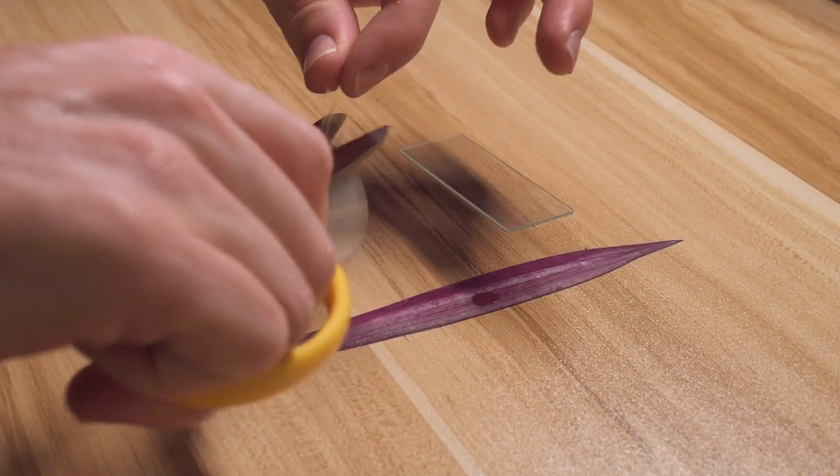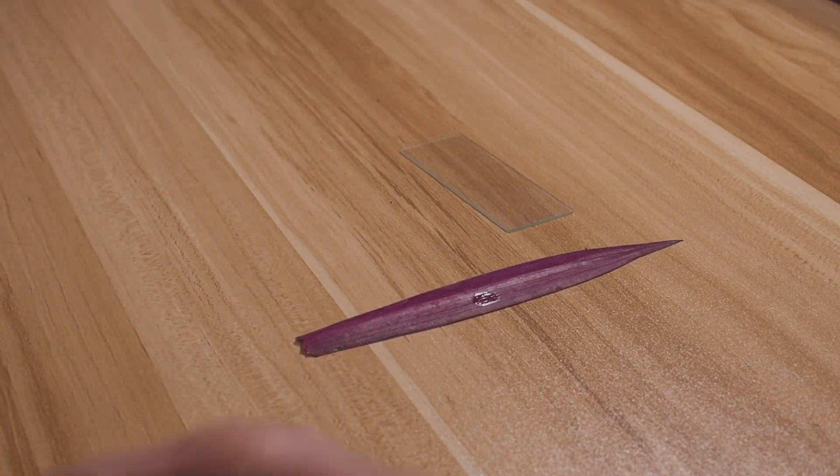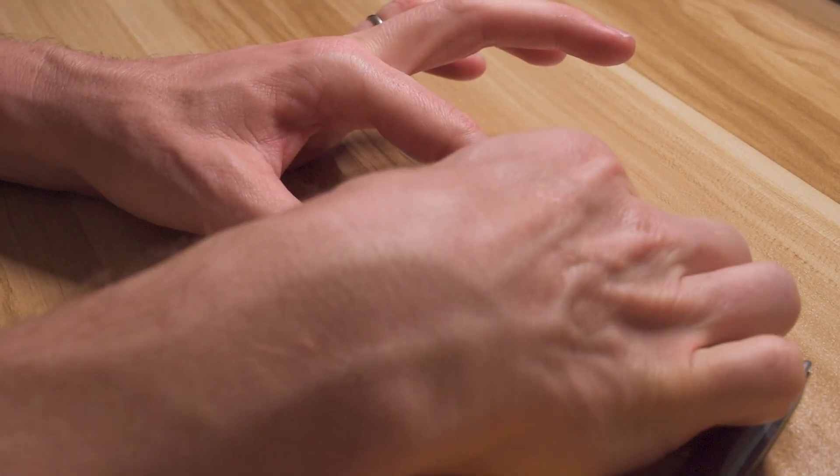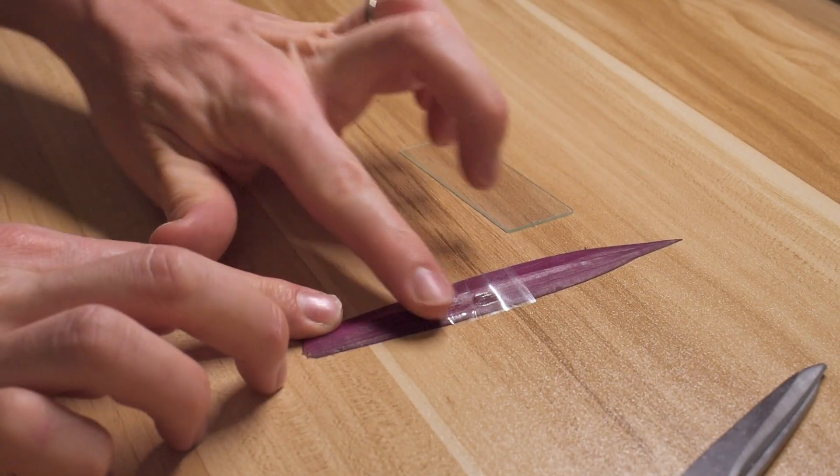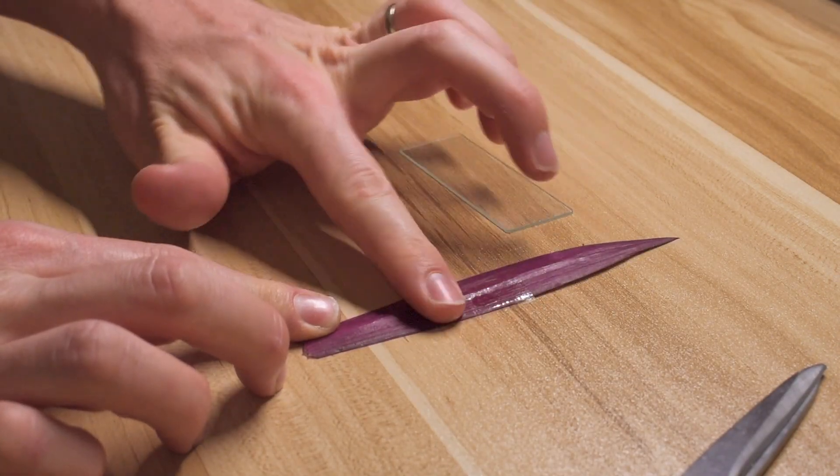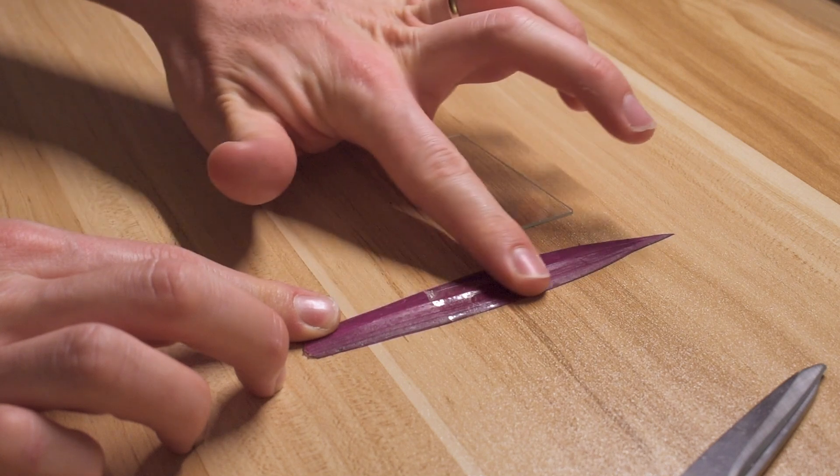then place some clear sticky tape over it. Push down firm enough to make sure it sticks evenly, but not enough to damage the leaf tissue.